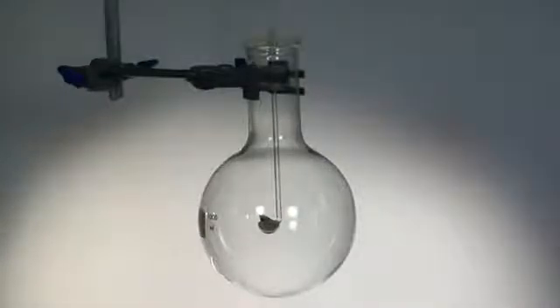White phosphorus is stored under water because it is spontaneously flammable in air. The element soon ignites and burns vigorously in the oxygen. This reaction is often referred to as the phosphorus sun.